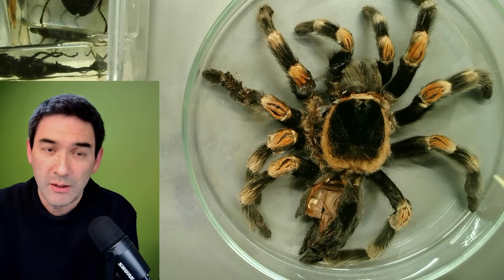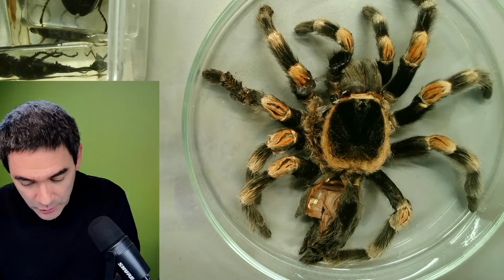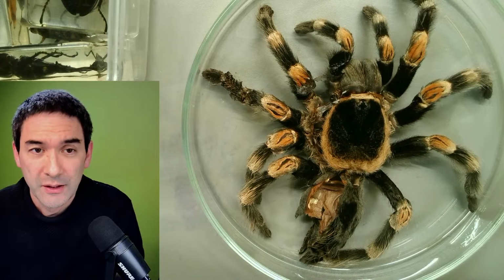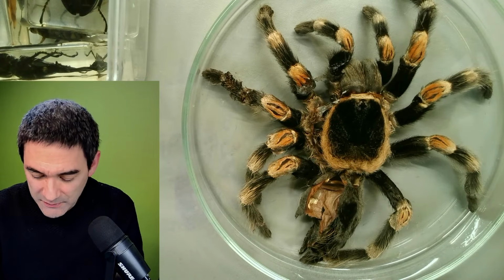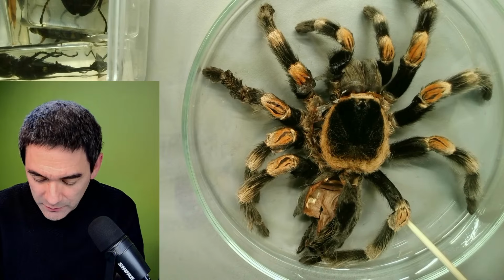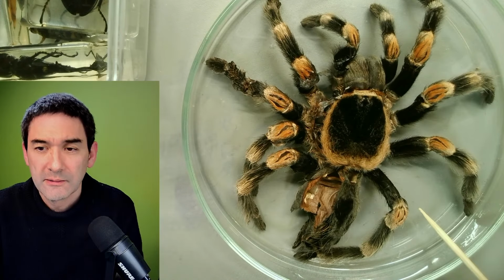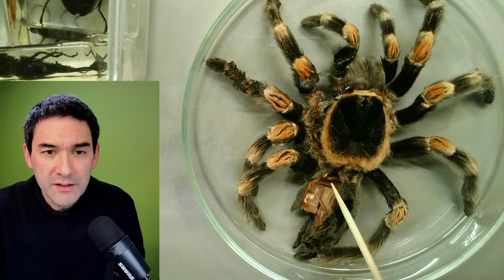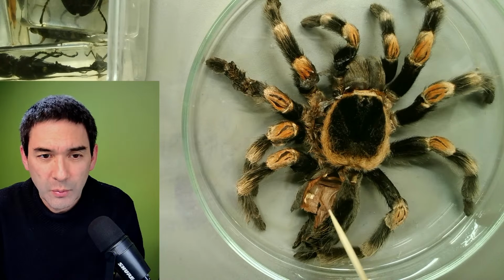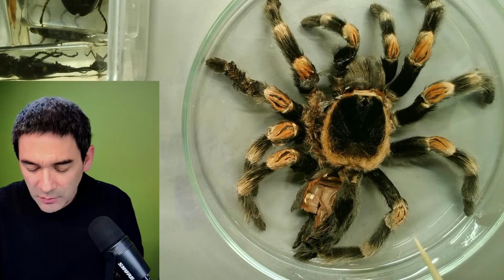So, wow, I think it's fascinating, but I don't want to have one of these crawling around. So just be careful, it's kind of brittle. And over here it seems to be actually broken open, where maybe the spider emerged as it molted. So what about the eyes?